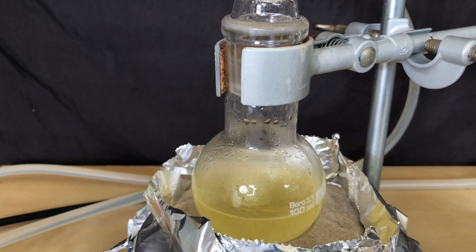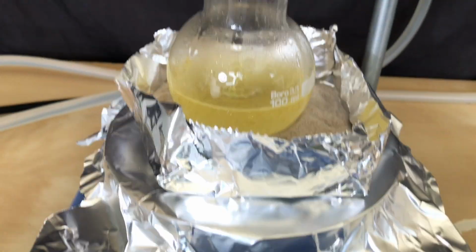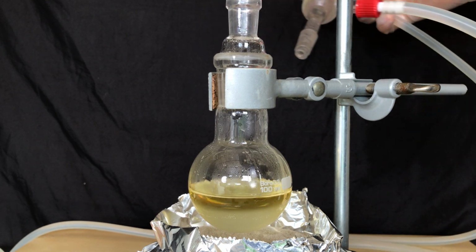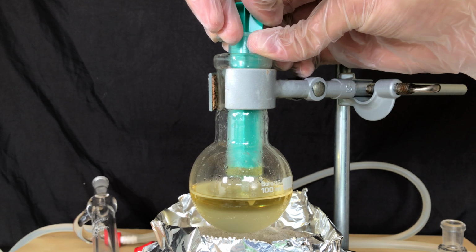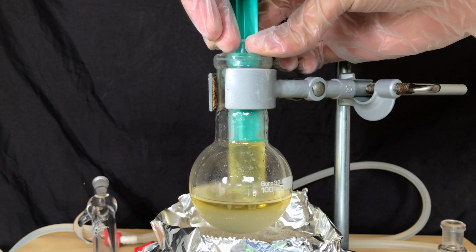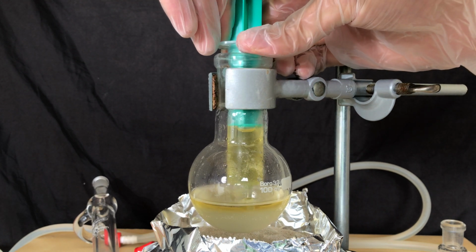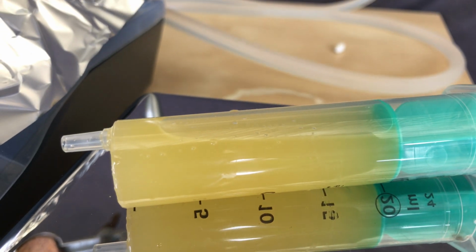The next day reflux was set up and I refluxed the mixture for 1.5 hours. After I was finished, we were left with this oily layer and the layer on top should be the diphenylbromomethane. It was quickly separated out using a syringe, which is a really crude method, but I got all of the aqueous solution out of the syringe and it should be fairly pure. When compared to an empty syringe, we collected 22.8 grams of bromodiphenylmethane.